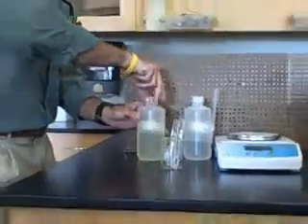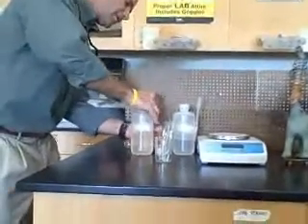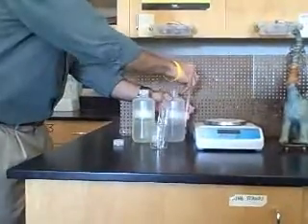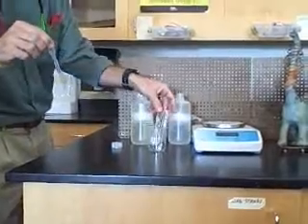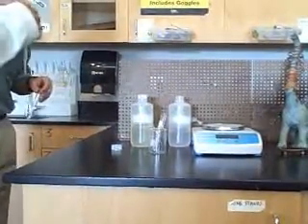Now I need somebody to do the second liquid. Let's have Diana come on over here. Same thing. Let me get rid of this one. So same thing. Use that liquid here.